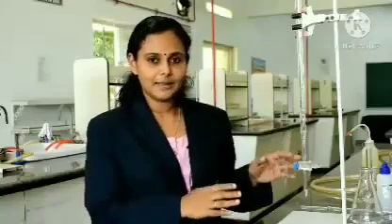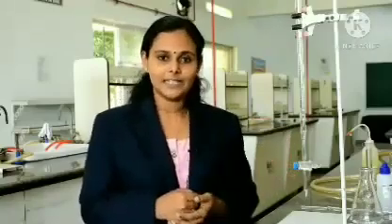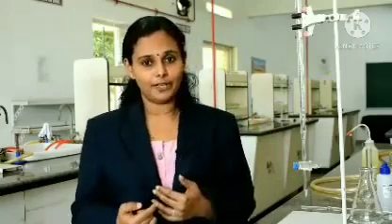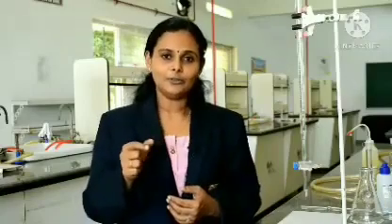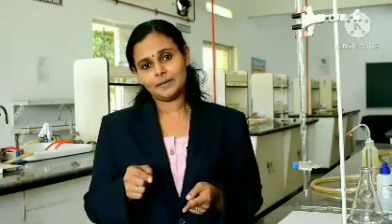Now, we have to get a concordant value, that is the same experiment has to be repeated so that you get the same value. Now, we have got 17.1. So, if you repeat the experiment, you should get 17.1. Otherwise, you have to repeat it once more to get a concordant value. A concordant value means a value which is the same as the adjacent experiment. If the adjacent experiments have the same value, we call it a concordant value. So, for titration we use the concordant value.